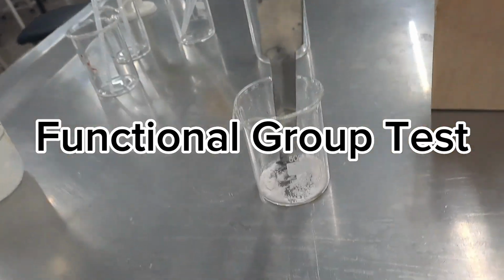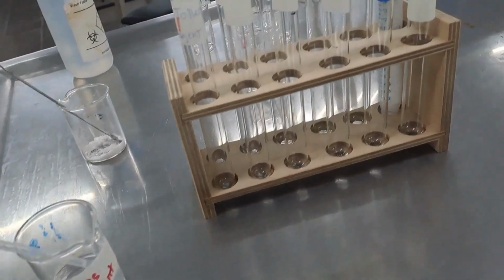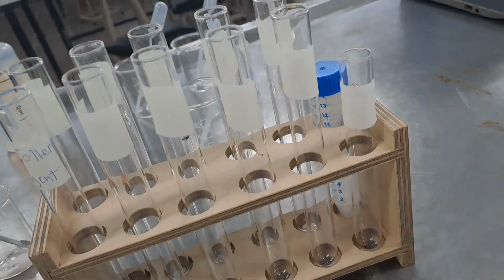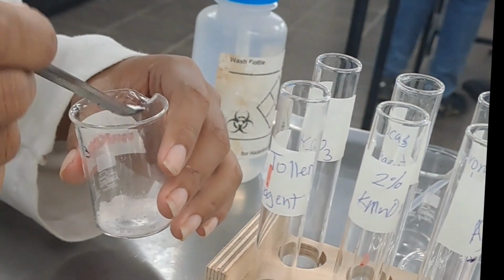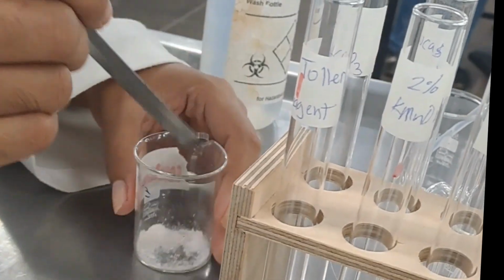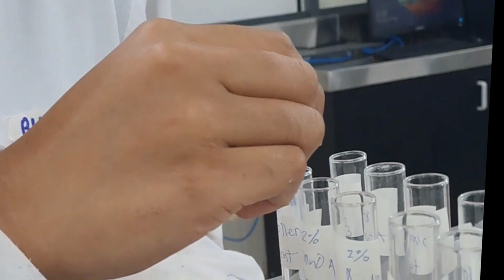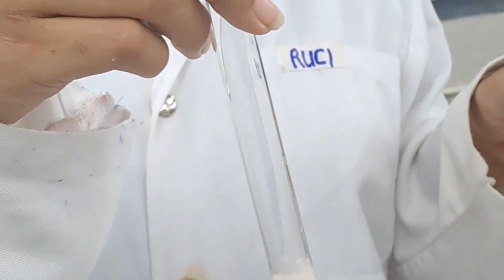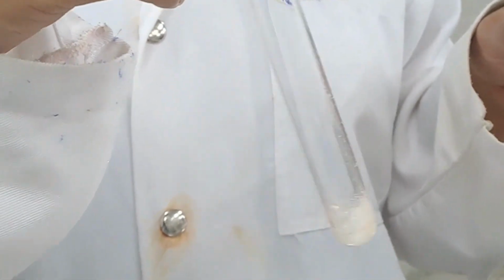For our functional group test, as you can see, here is our unknown and the 10 different reagents that are going to be used. First off, we're going to place a small amount of unknown into the test tube, and then add a few drops of Tollens' reagent into the test tube. Shake the test tube carefully and observe the mixture. Upon observation, the unknown was insoluble in the Tollens' reagent.